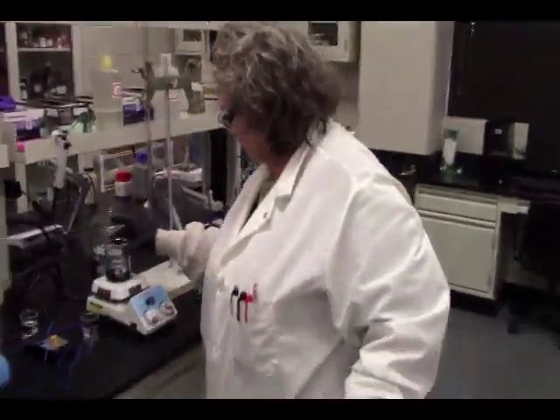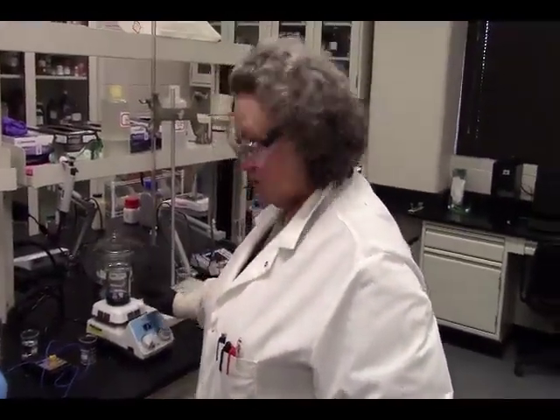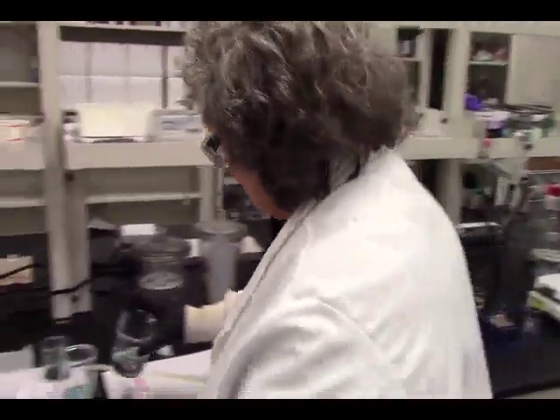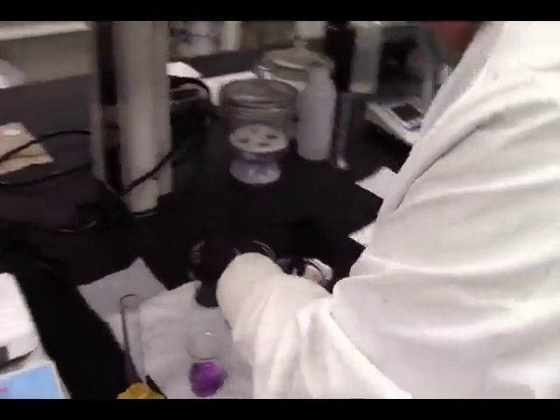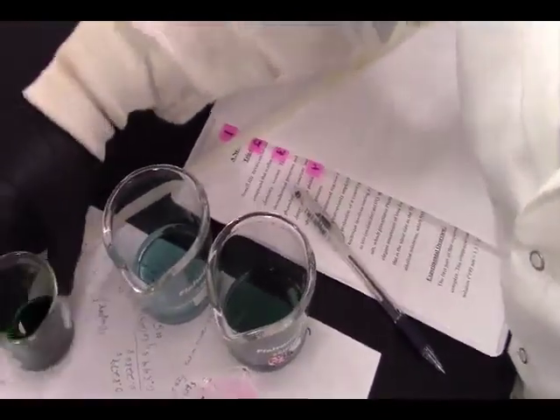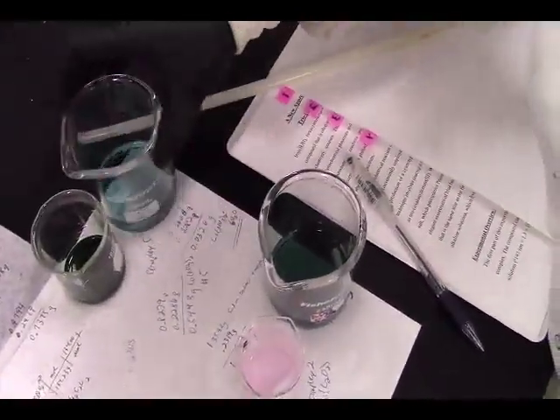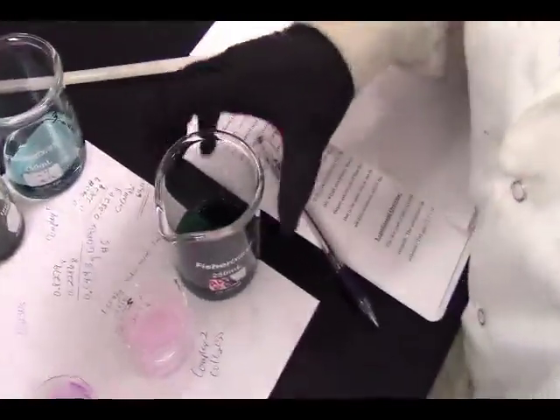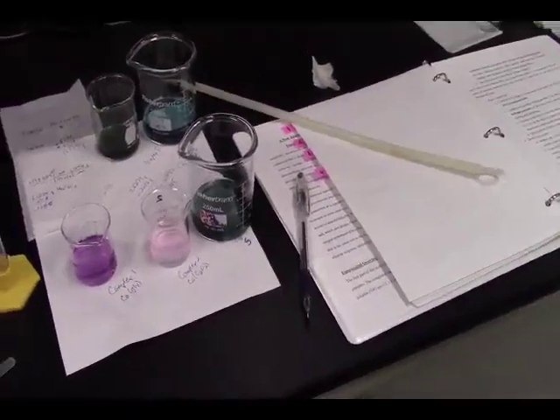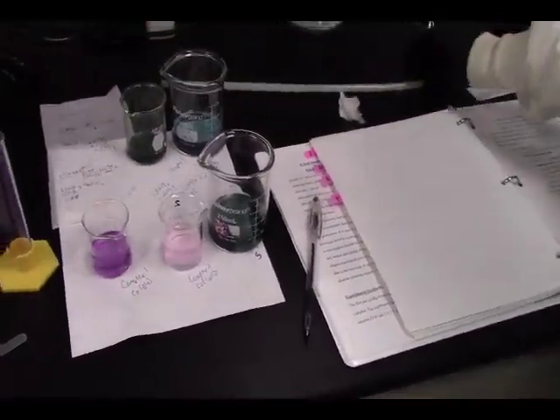Well, we will use the one that did not stir so long because I think this one's going to be more accurate. Okay, so we're going to take this and replace this with it. That's our color differences. And so we may have let this one stir too long before we added our nitric acid to quench it. This is the one that we made where we did it quickly like the procedure said. We're going to follow the procedure.